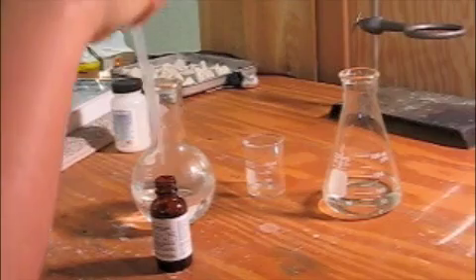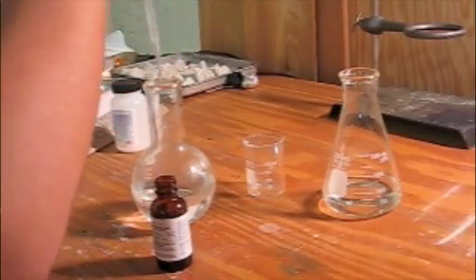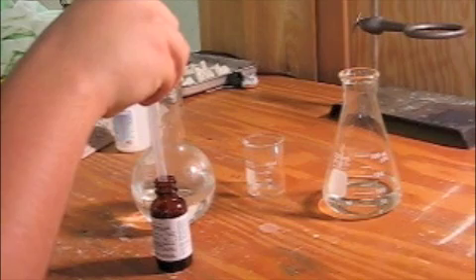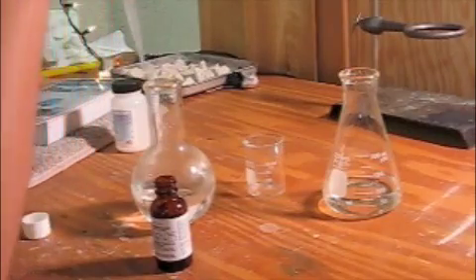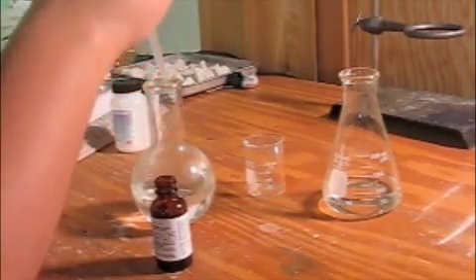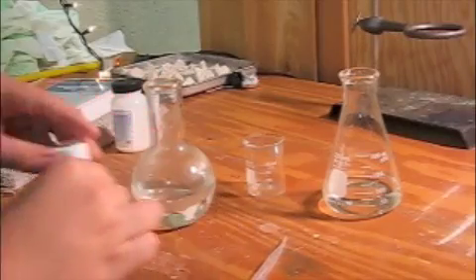I'm doing this with a regular disposable pipette. It doesn't really matter what you use. You can even just drop it in with the bottle.